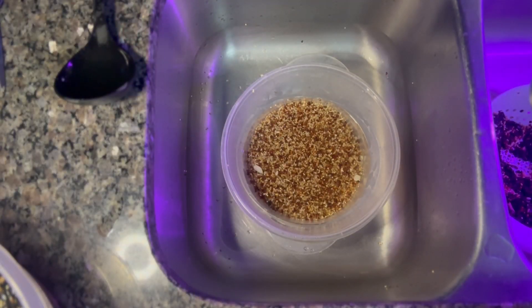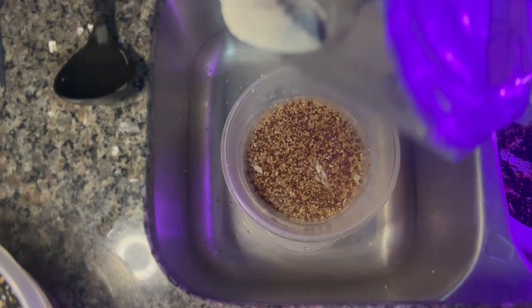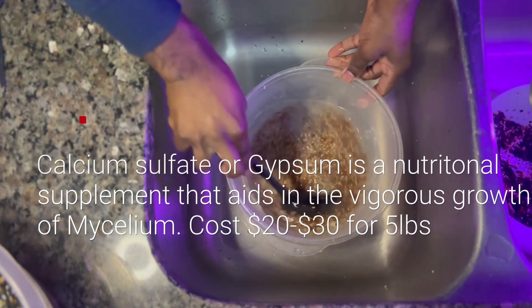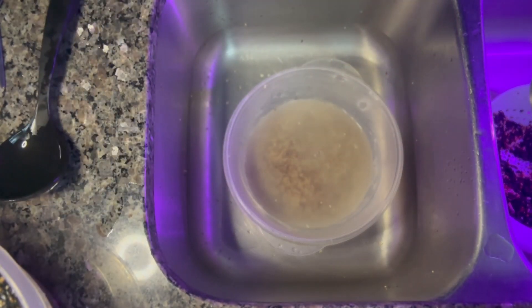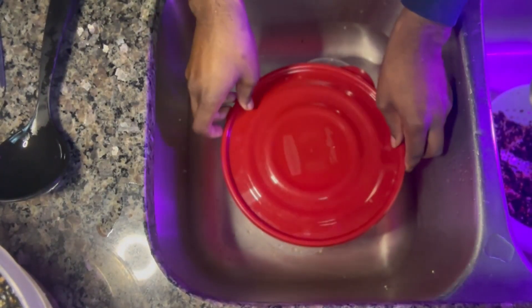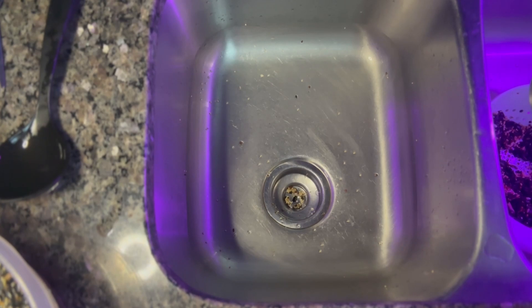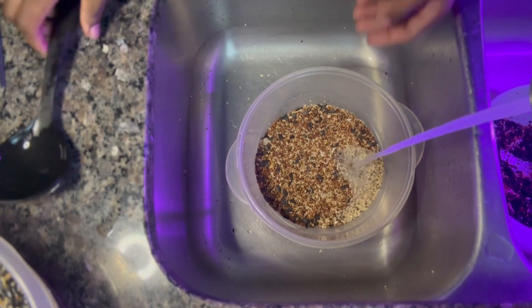Last but not least, what we'd like to do is take our calcium sulfate — or gypsum — like what we have here, and just add one scoop to every Tupperware bowl with your grain. You want to mix that in really good. Then grab a top, cap it off, and put it to the side. You want to do the same thing with every bowl of grain.